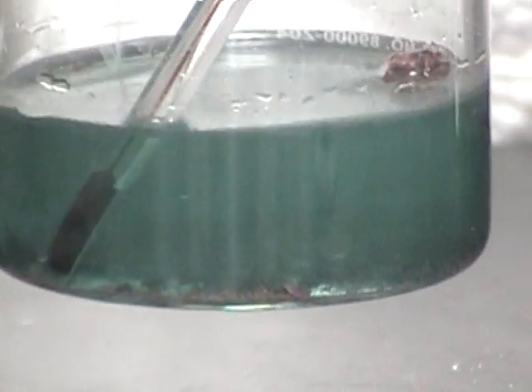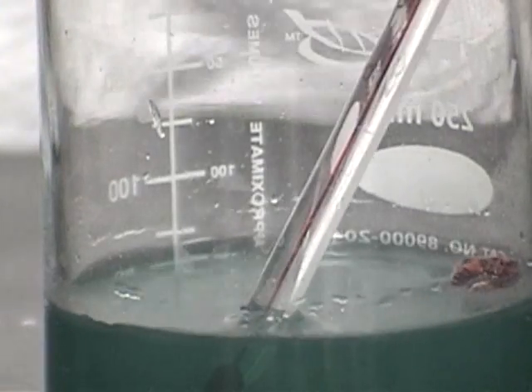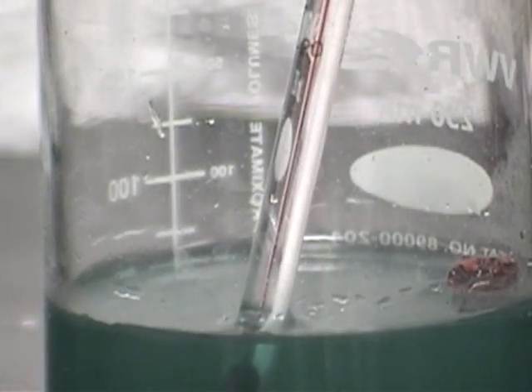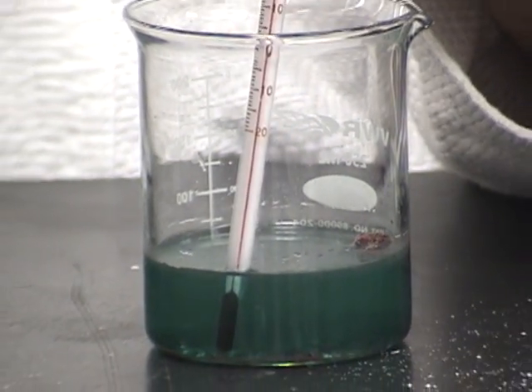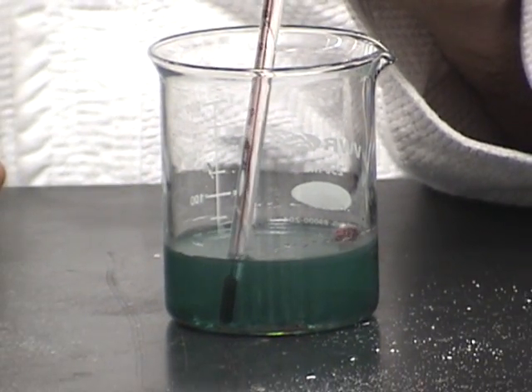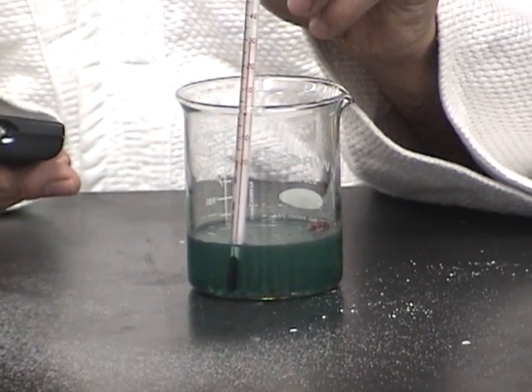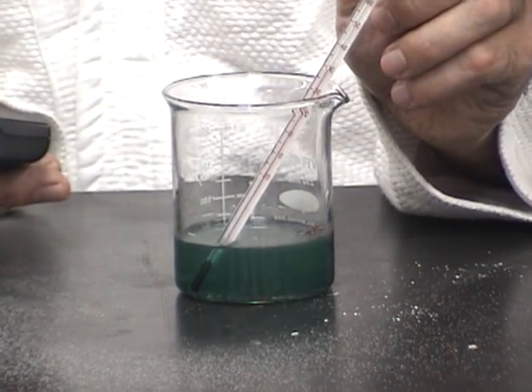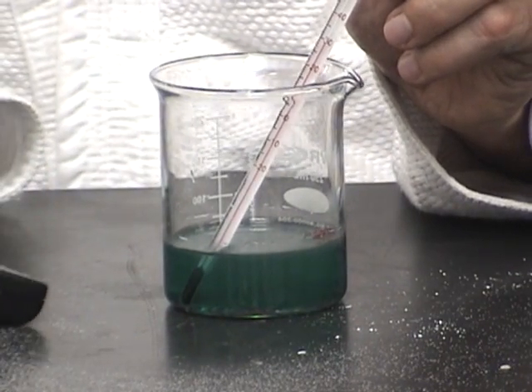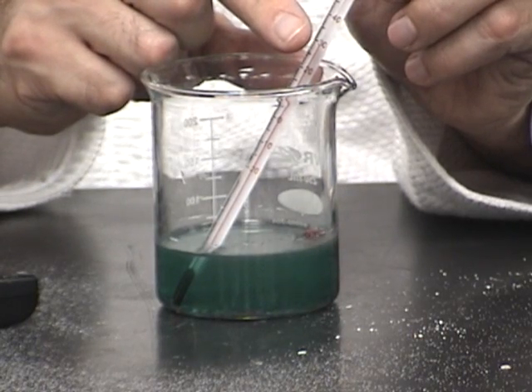Oh boy, now the temperature's gone up significantly. We're all the way up to 30 degrees centigrade. Pop back out so you guys can see that. And we are definitely at 30 degrees centigrade. Maybe if I can zoom in a little bit, you can see it a little bit better. And right about there, that's about our 30 degrees centigrade mark.